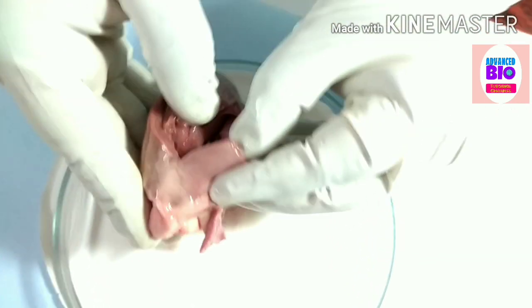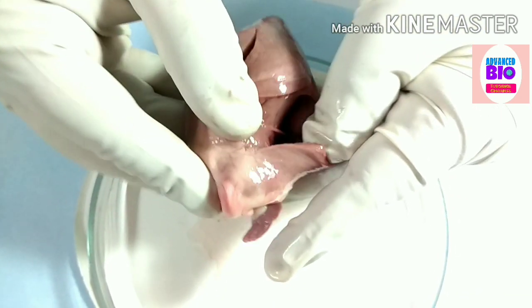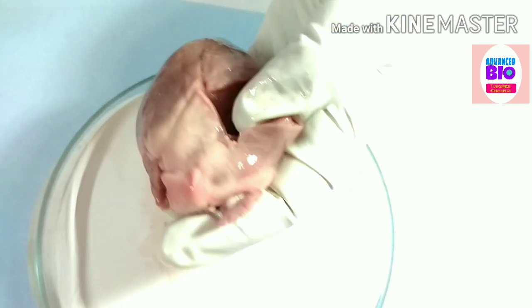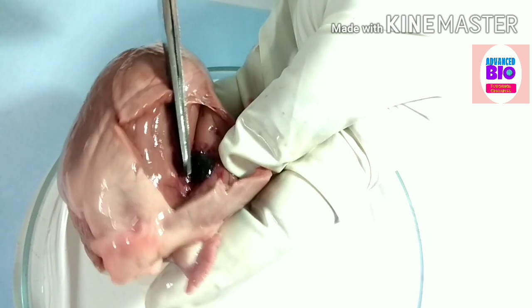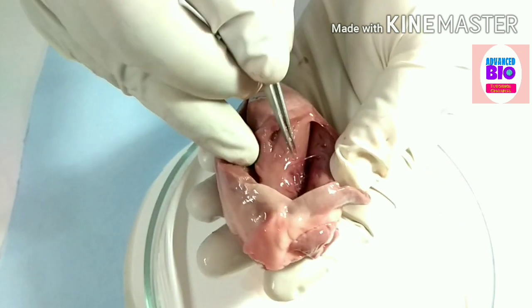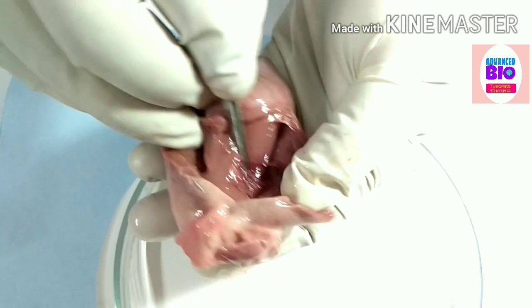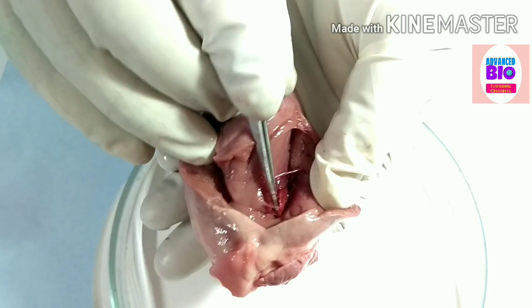Now see — this is the right ventricle. You can see here there is blood clotting. Now see the papillary muscles — these are all papillary muscles. See the chordae tendineae, like this — these are the chordae tendineae.